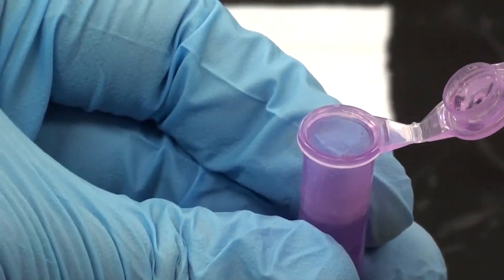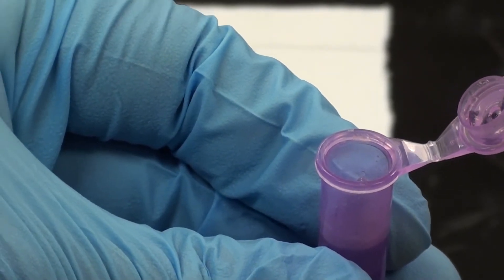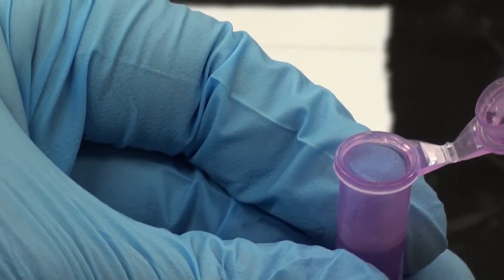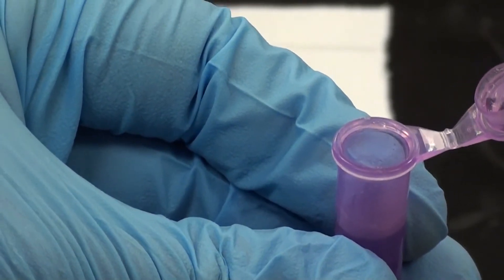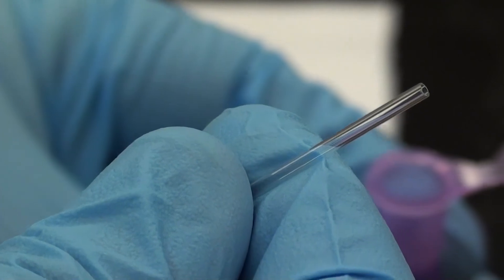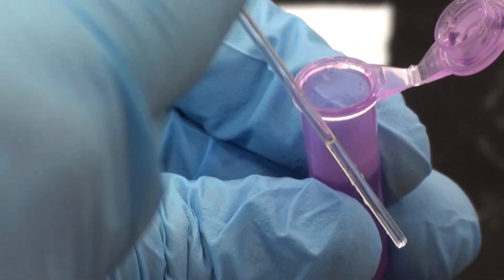And what I'm going to do is I'm going to put the capillary into the sample. And the sample is going to run up the capillary just by capillary action. Now keep in mind, I don't have to do anything else with this capillary, like put my finger on top or anything else. Just leave it the way it is and the liquid will run up all on its own. So here's what's going to happen. Alright, so you just dip it in and you can see the sample has run up the tube all by itself.